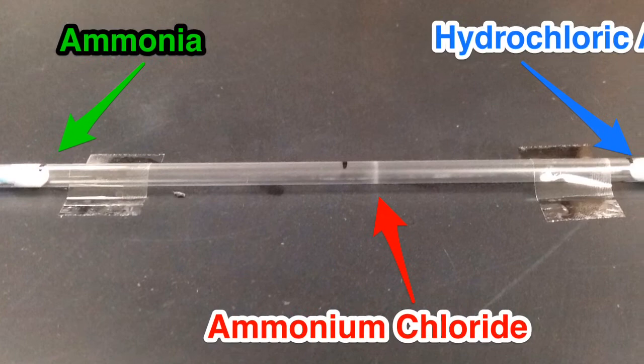So the question now becomes, why is the line to the right of that midpoint?